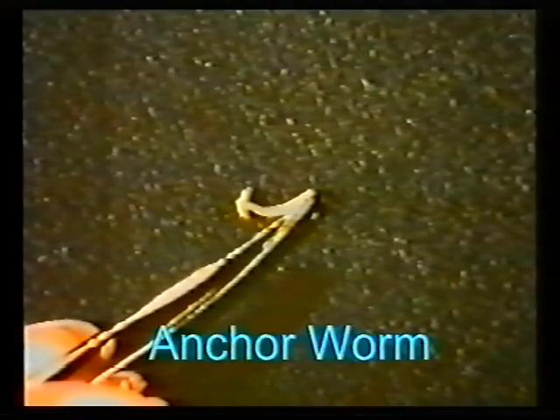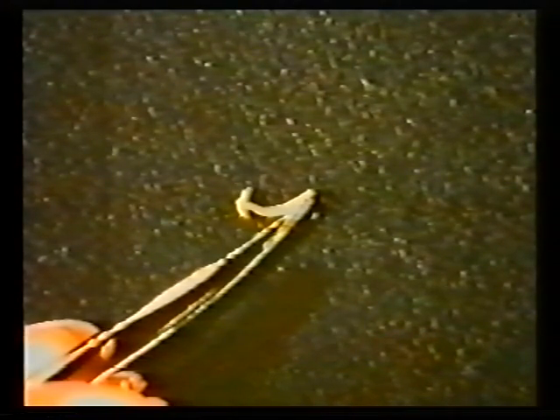As the common name suggests, female anchorworm have the ability to penetrate the fish skin and firmly anchor themselves, burying their heads deeply into muscle tissue and various organs including the gills. The head continues to develop into a twin structure using a process called the cephalic process, and this can clearly be seen here. During the cephalic process, anchors or hooks develop which assist in holding the organism in place during the remainder of its life.